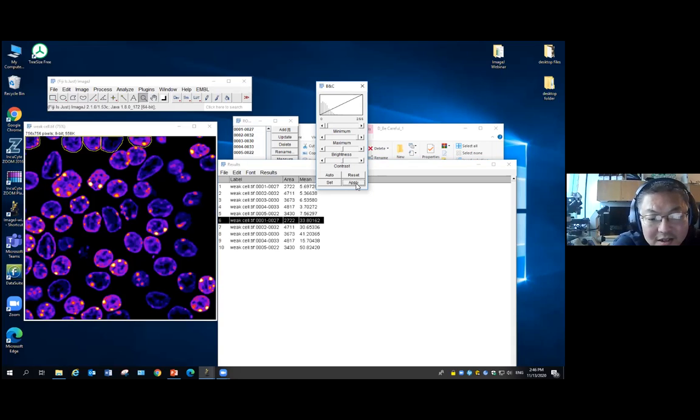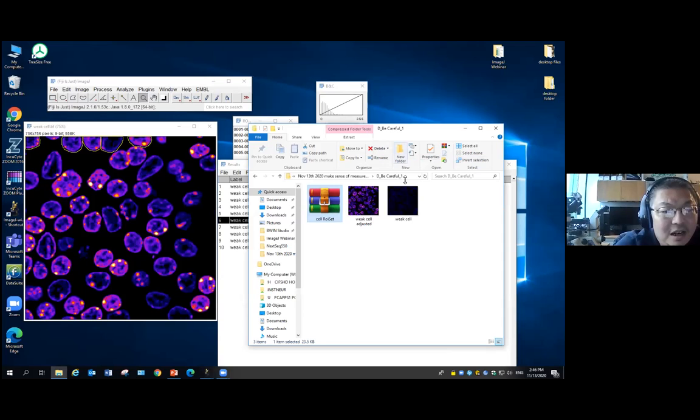Normally, I strongly suggest you do not click apply unless you know exactly what you are doing. If you click this one, you change the pixel intensity, many times in an unnormalized way, and you can't really get it back. You can always play around.